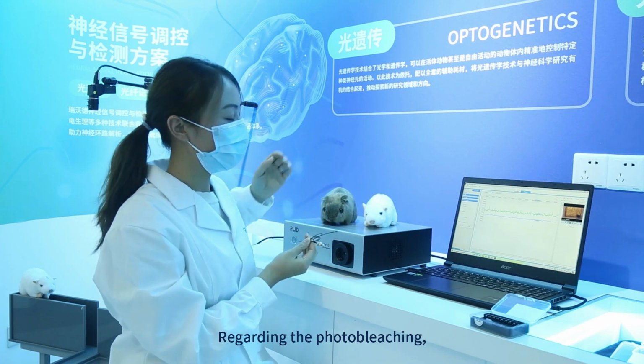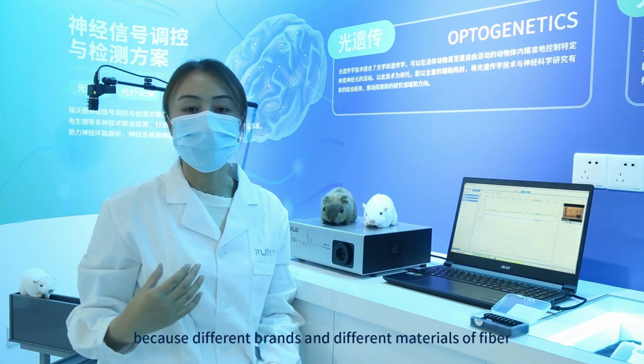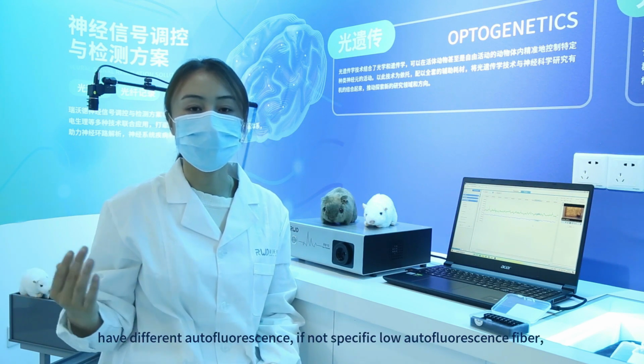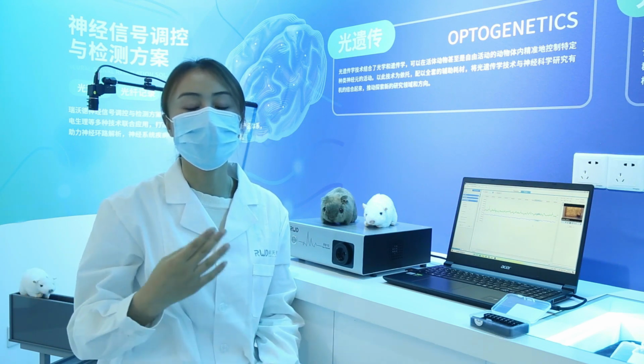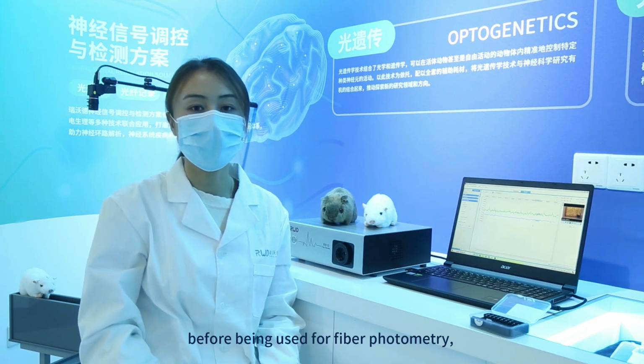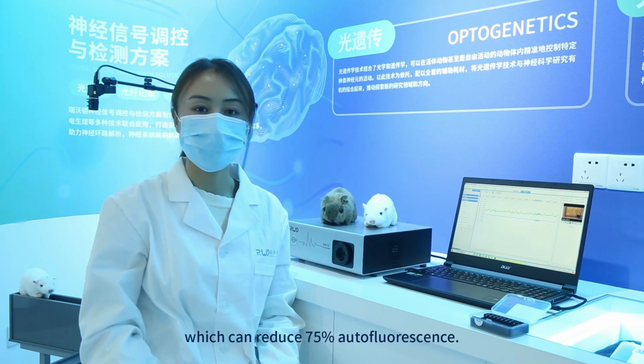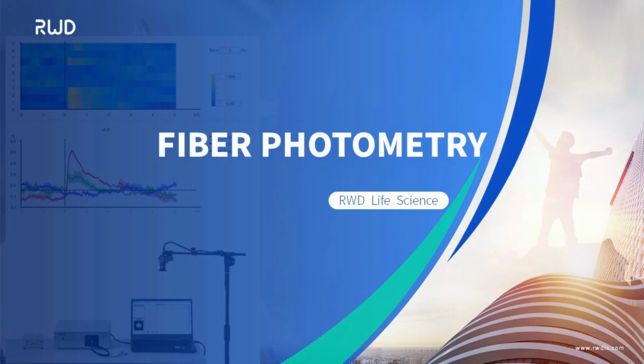Regarding the photo bleaching, because different brands and different materials of fiber have different autofluorescence, if not specific low autofluorescence fiber, ordinary fiber needs to be bleached with a laser for 1.5 hours before being used for fiber photometry, which can reduce 75% of the fluorescence.